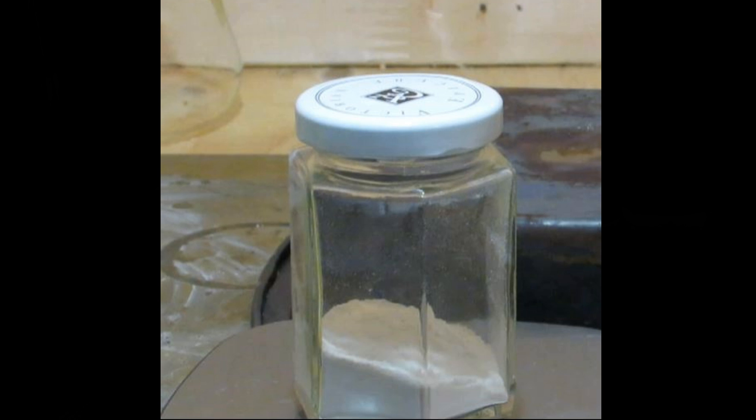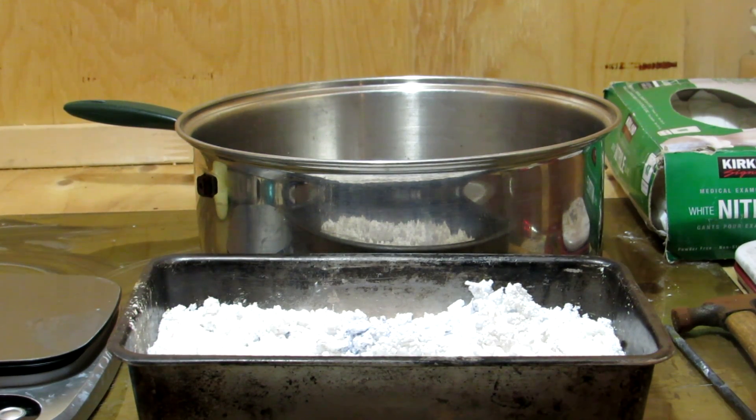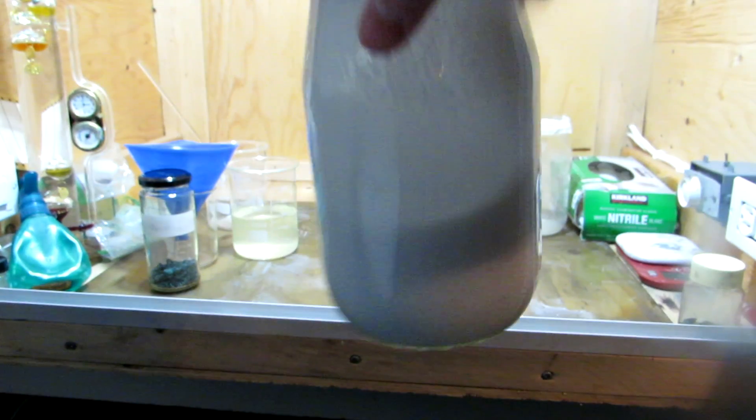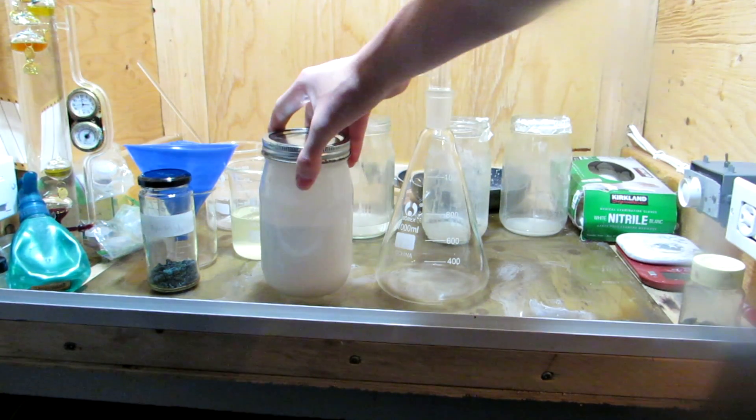Alternatively, the sodium silicate solution can be completely boiled down, crushed, and added to some ethanol. The impurities and unreacted sodium hydroxide will dissolve into the ethanol, leaving a sodium silicate suspension which can be filtered off to obtain pure sodium silicate.